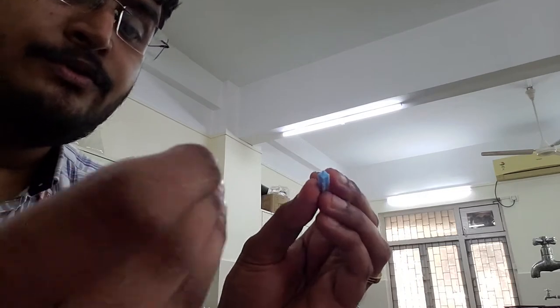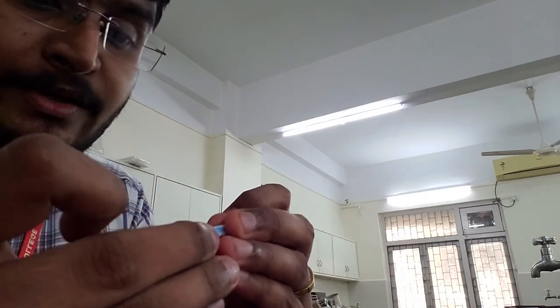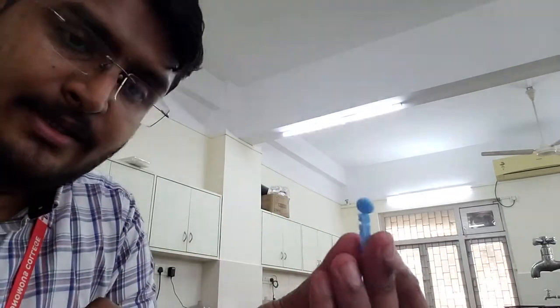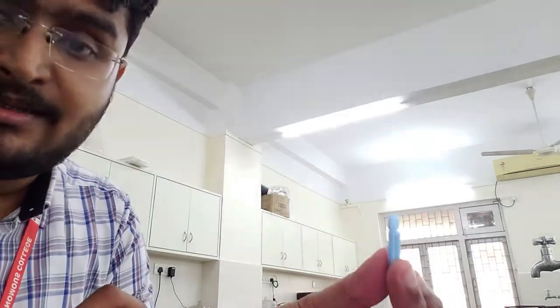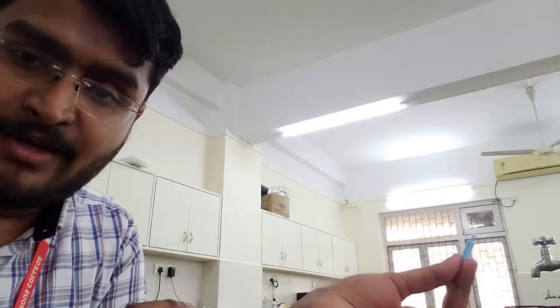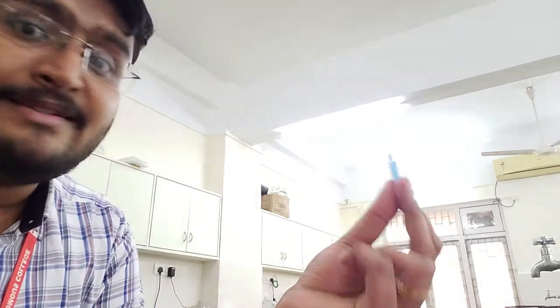Till then, please remember that the lancet that you have used, you have to close it again. Check where the aperture is and close it properly. Once you close it, now you are ready to discard this. Please never discard this open for the basic reason that this might end up hurting someone else. Let's discard this safely into the dustbin.